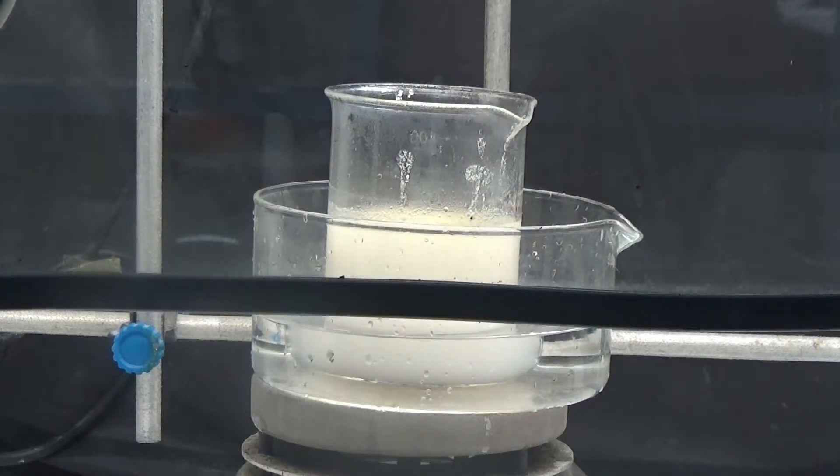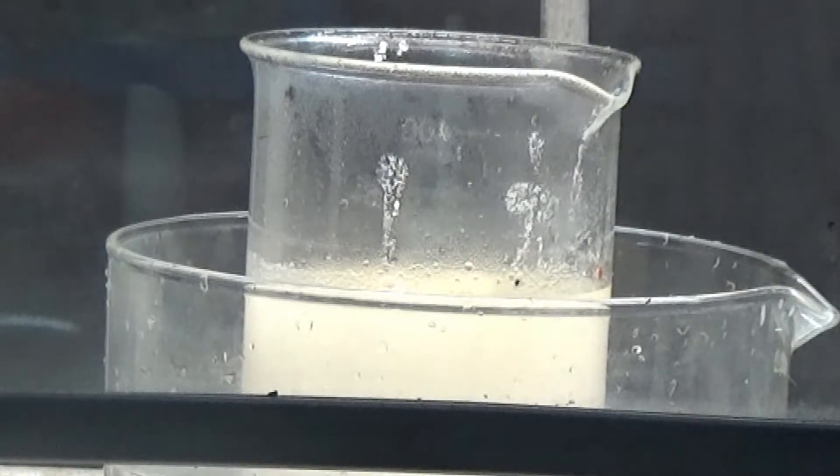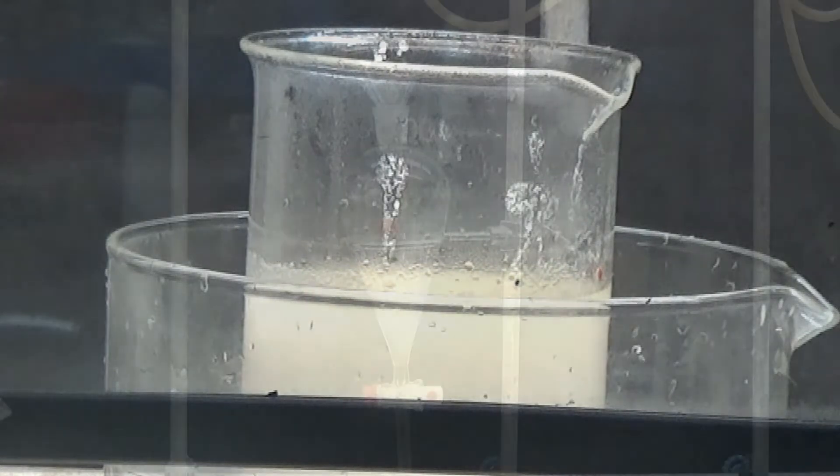In this operation, sulfur dioxide is released, which is very irritating. Work in a fume hood or outdoors. An orange oil is observed floating on the surface.